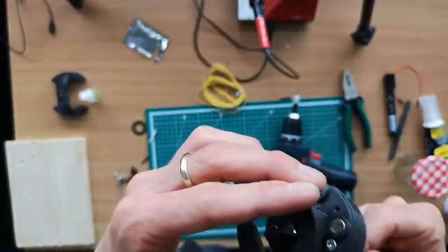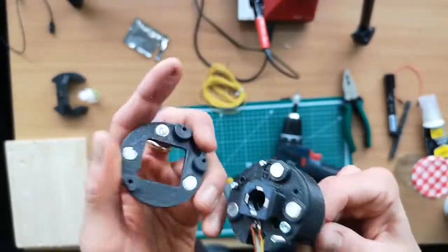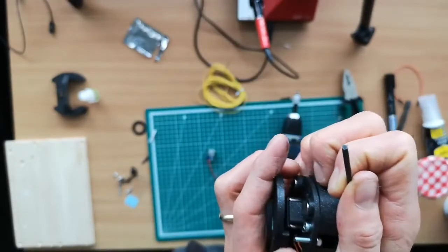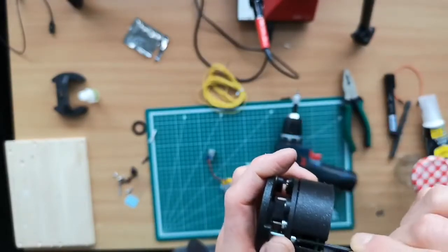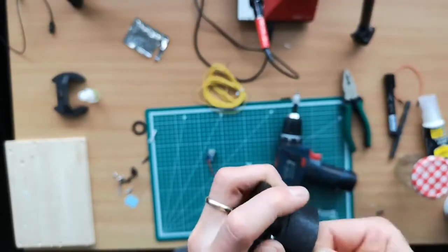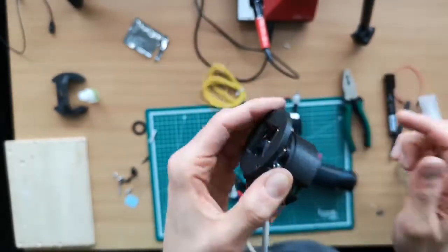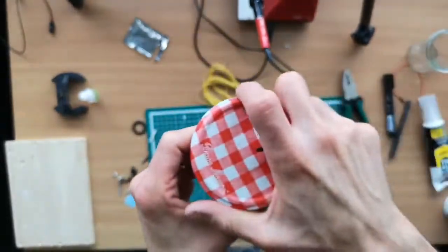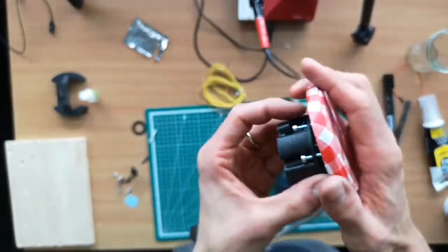And then with this you have to find the right hole. In this case it's this hole here, and then you have to essentially screw this thing in here. And so this plate here mounts to the bottom of the glass, so in the end it will stick to that, and then we observe through this glass here, through the bottom here.